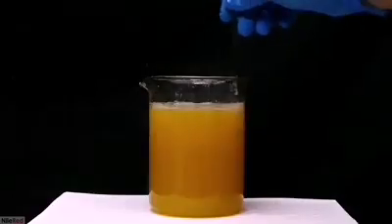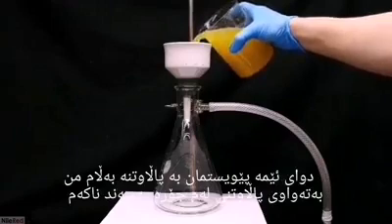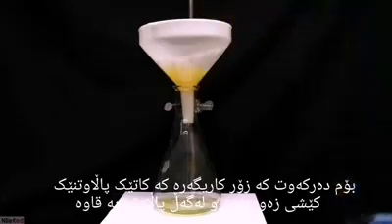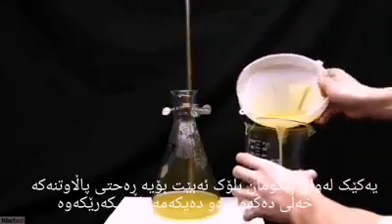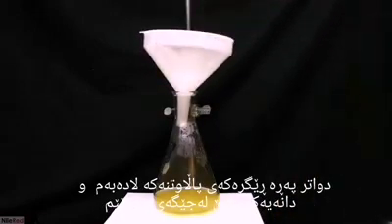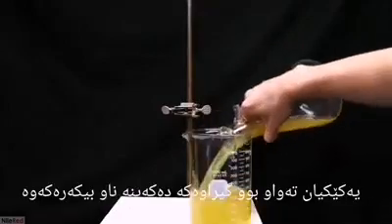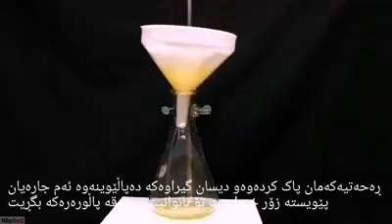What we have here is a solution of sodium citrate with a lot of precipitate and pulp. We need to filter it off, but I don't really recommend using vacuum filtration — the filter paper gets very quickly blocked and liquid stops coming through. I found it was much more effective to do a gravity filtration with coffee filters. Once the filter inevitably gets blocked, I take off the funnel, pour the liquid into a beaker, replace the filter paper, and continue. This process was repeated 3 or 4 times over a couple of hours. The filtrate was then transferred and filtered a second time, which was much quicker.